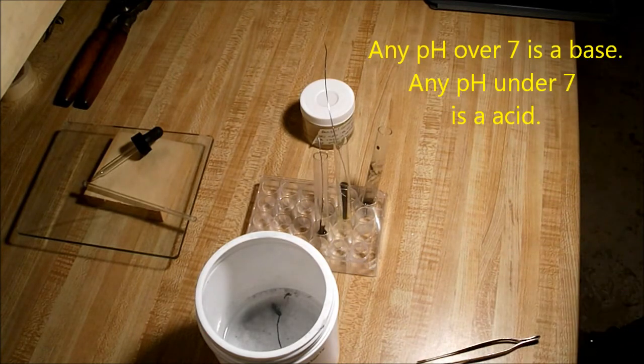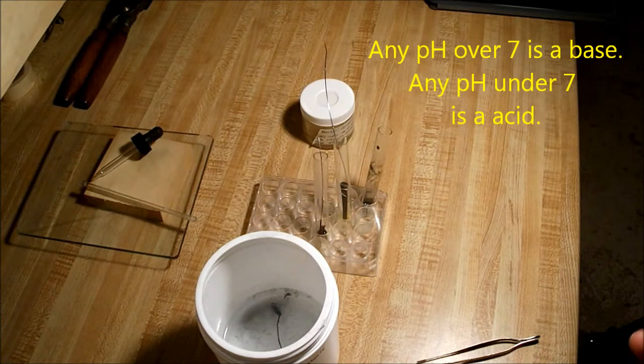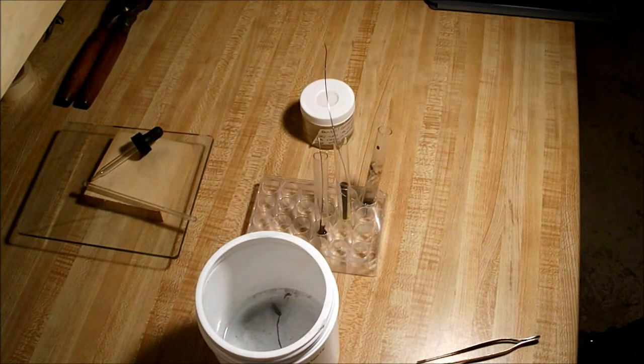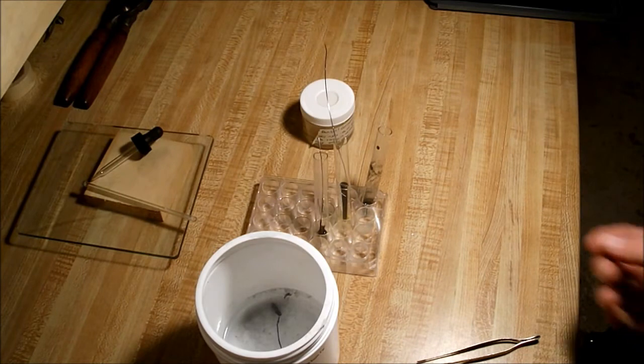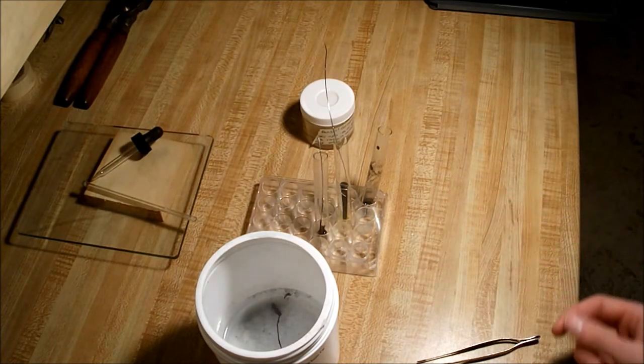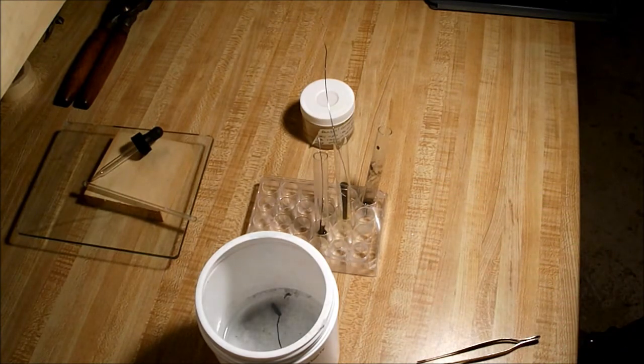You don't want the pH to be too high when disposing of acids, basically returning the acid back to water with a base, because if the base is too high and the acid pH is too low, it could just go ballistic, and I've had that happen where it splatters all over the place.